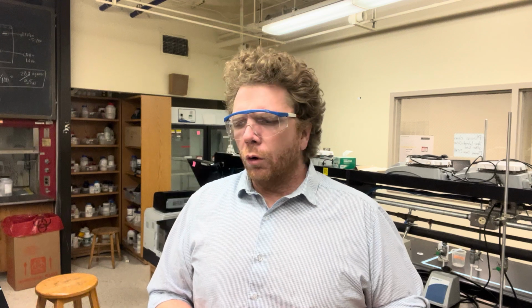So the purpose that we prepared these different solutions for really boils down to when you're working with an unknown protein. You have no clue what the concentration of that protein is in a given solution. So we use a Bradford assay to kind of determine roughly what the concentration is. But there are some instances where you might be working with a protein that is too concentrated, or the amount of protein in that solution is higher than what you find in your standard curve, in your line of best fit.